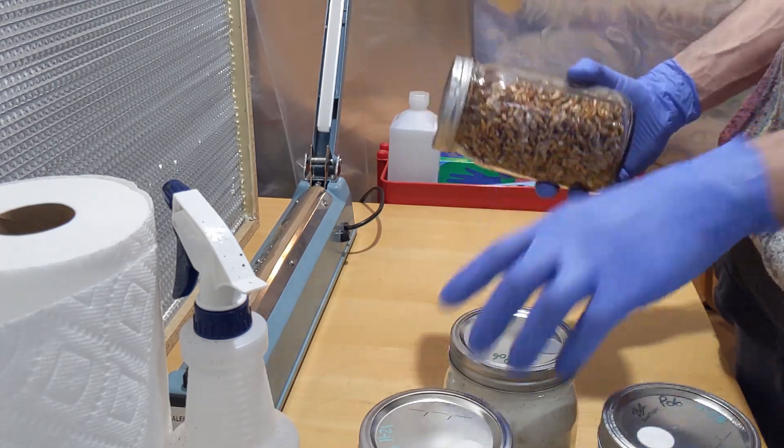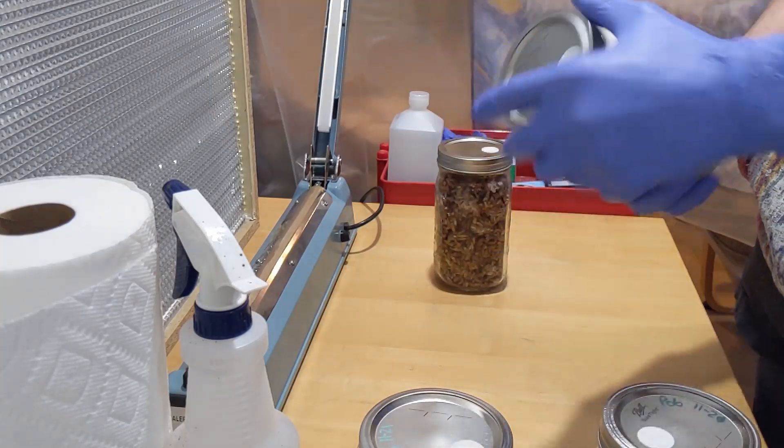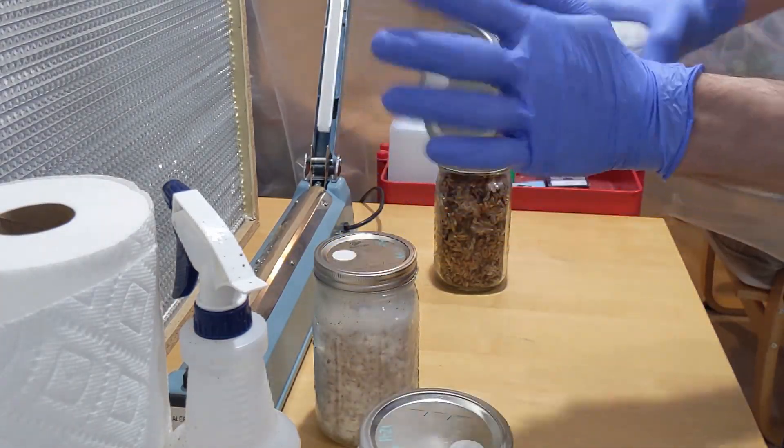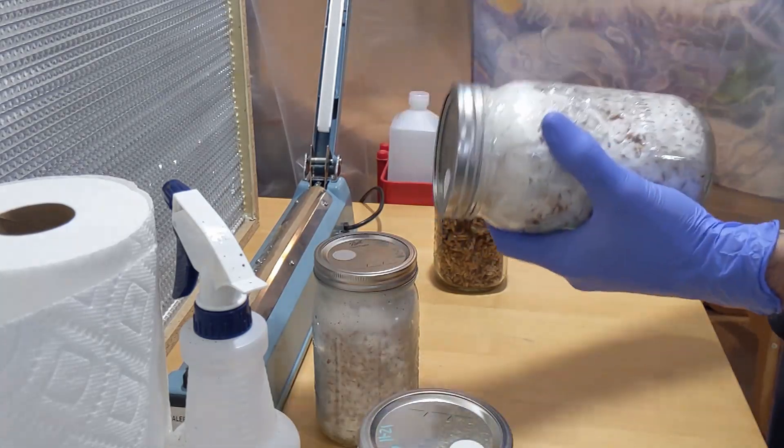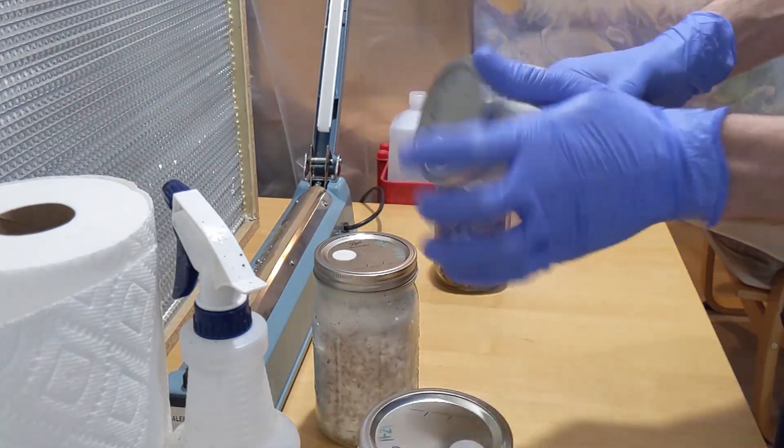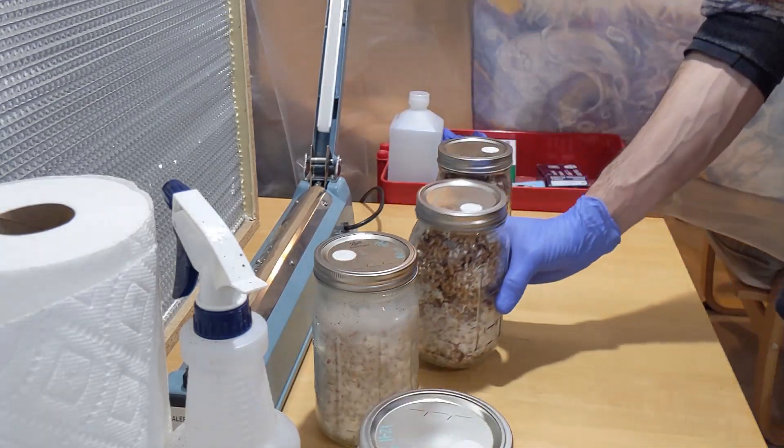First, I like to see how this jar is nice and loose, so I like to just break my jars down first before I do anything. It just makes everything easier to dump into the bags, so I'm just gonna go ahead and do that with all the jars. I'm gonna grab my substrate.